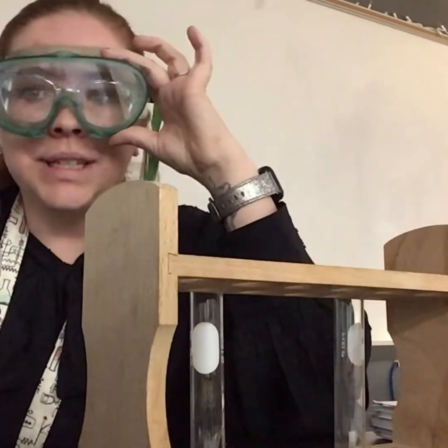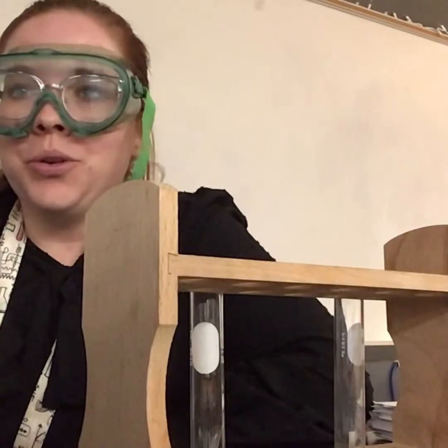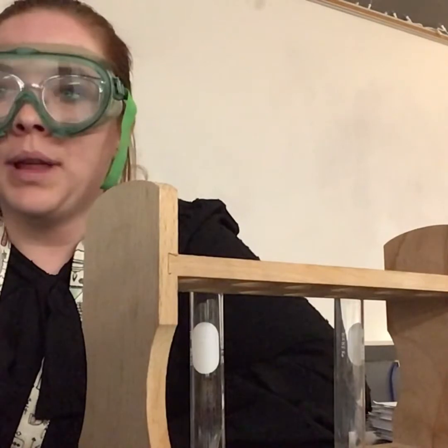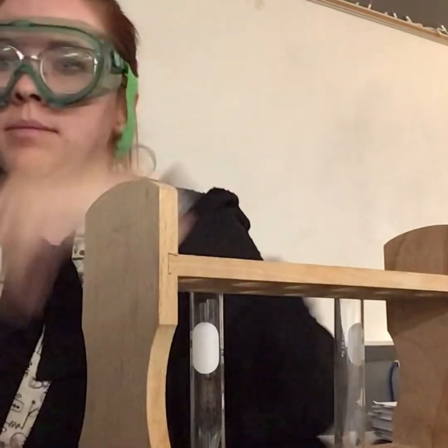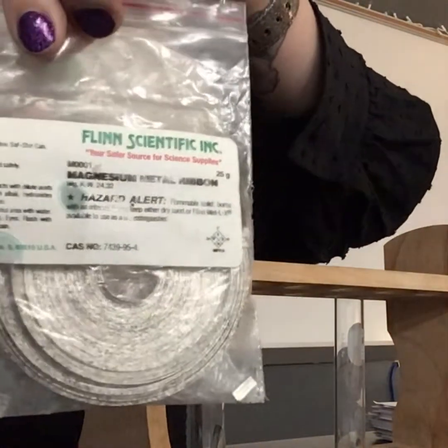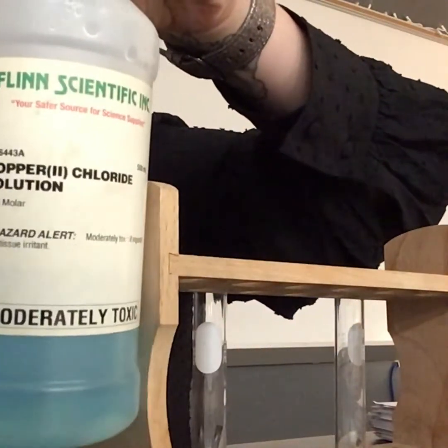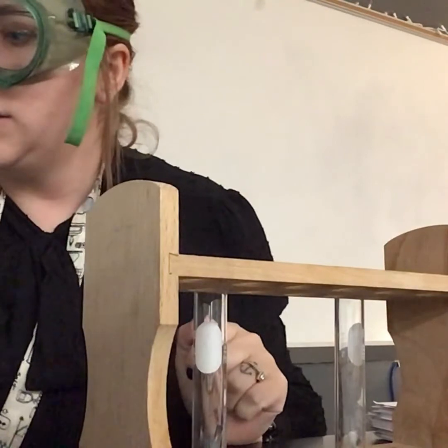Hey guys, today I just wanted to show you one of the types of reactions that we're going to be talking about. This is a single replacement reaction and it is with magnesium. I have a little piece of magnesium metal, and my other reactant is copper chloride solution.